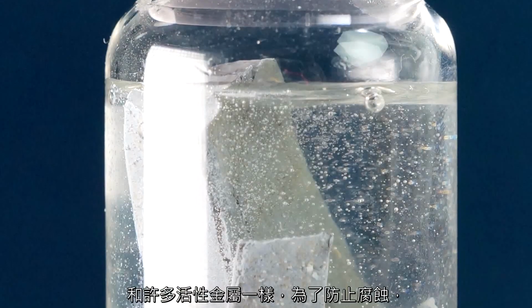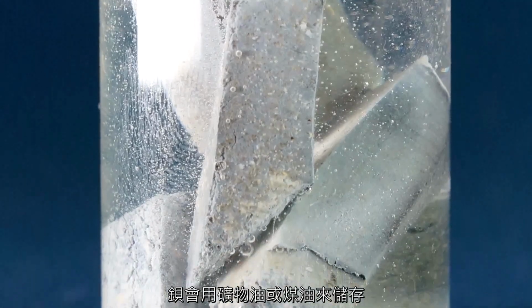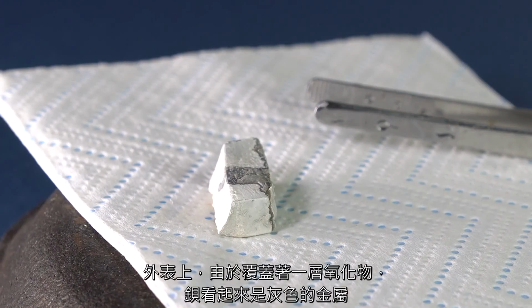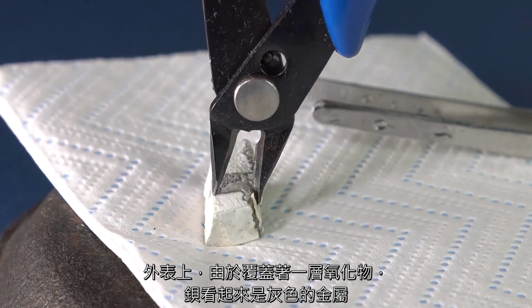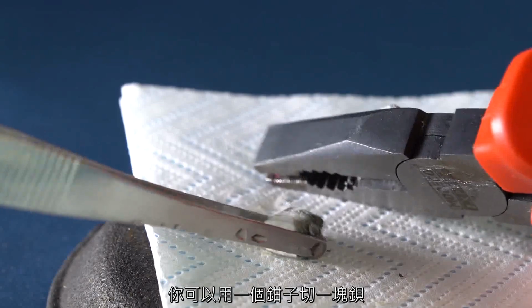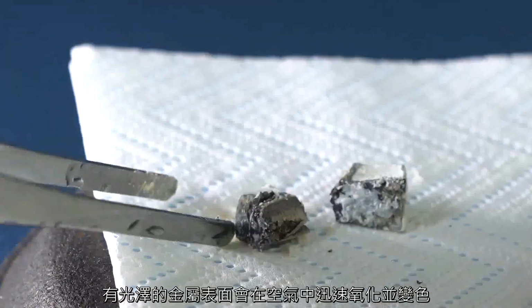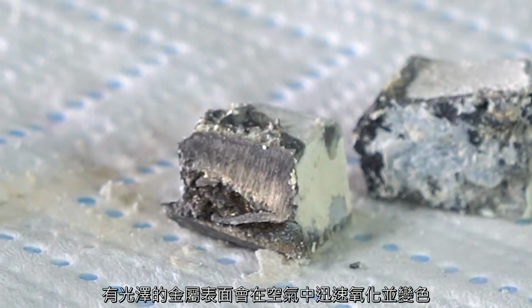Like many active metals, to protect it from corrosion, barium is stored in either mineral oil or kerosene. Externally, barium looks like a gray metal due to the oxide layer covering it. The hardness of barium resembles lead. You can cut a piece of barium with a pair of pliers. On the cut, you can observe that the shiny metal surface quickly oxidizes in air and tarnishes.